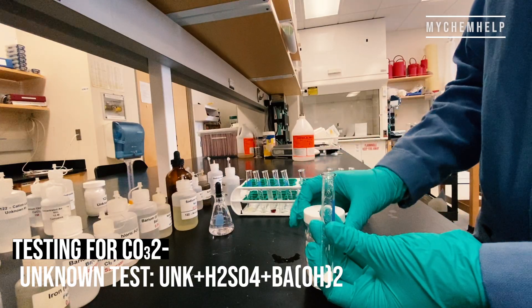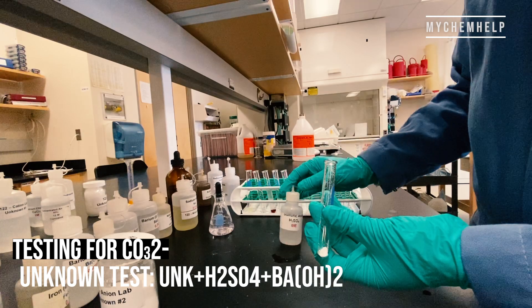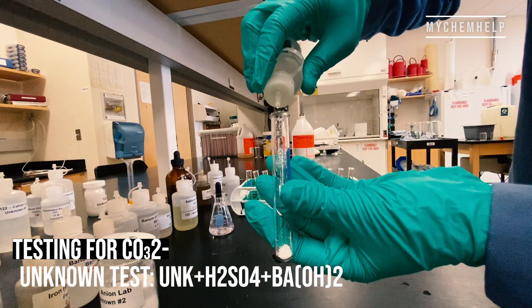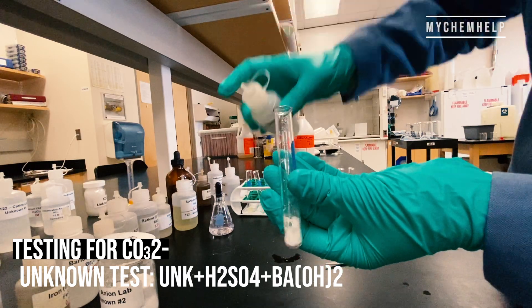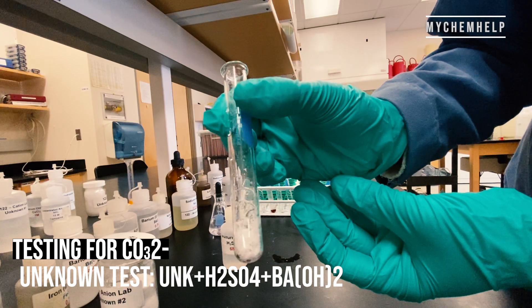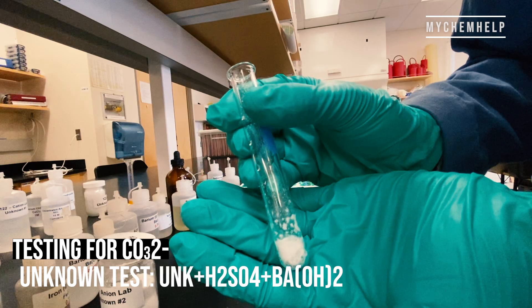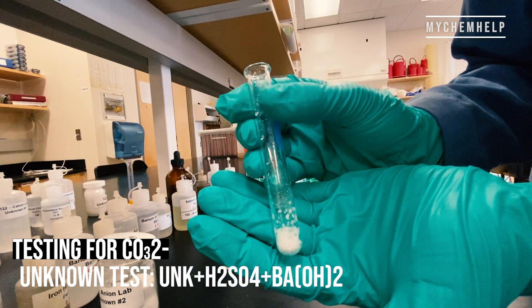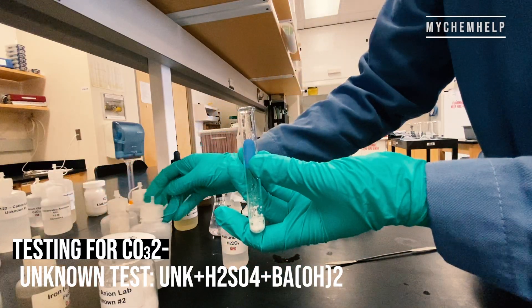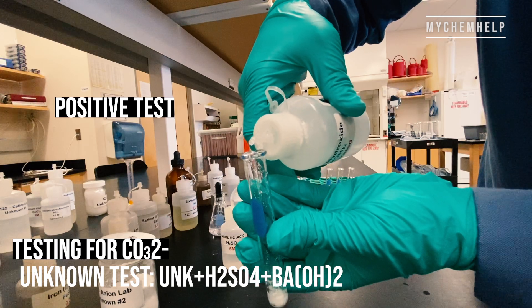The next test is for the carbonate ion. I went ahead and did the unknown test because I was really pressed for time. There's the unknown solid with sulfuric acid. The lab notebook said we should see gaseous evolution with the addition of sulfuric acid. I'm taking a drop of barium hydroxide over the top of the test tube to see if it turns milky — and we've got a positive test there.